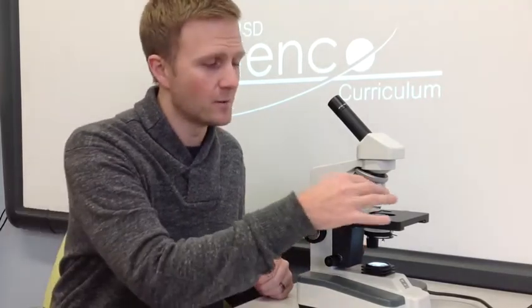Alright, we're ready to use the microscope. Today we're going to be looking at some small intestinal cells. Remember, your small intestines help you digest and absorb nutrients when you eat food. Now, the first thing you want to make sure before you place the slide on the stage is that the stage is as low as it can go. You do not want to start the stage high and close to the objective lens, so make sure that's down as low as it'll go. The other thing is that you want to start with the lowest magnification power, and on our microscope today, that's 4 times. This allows you to more easily focus the image to start with, and then you can work your way up to higher objective lenses.